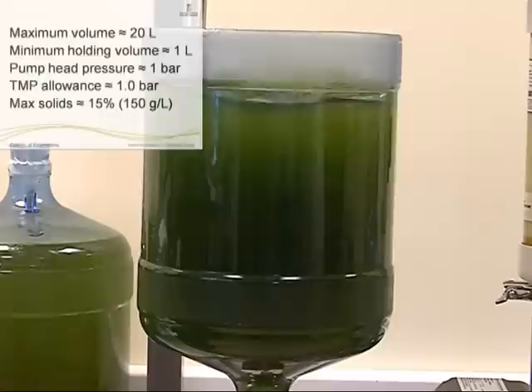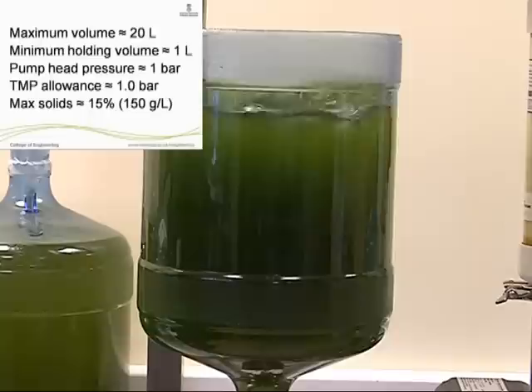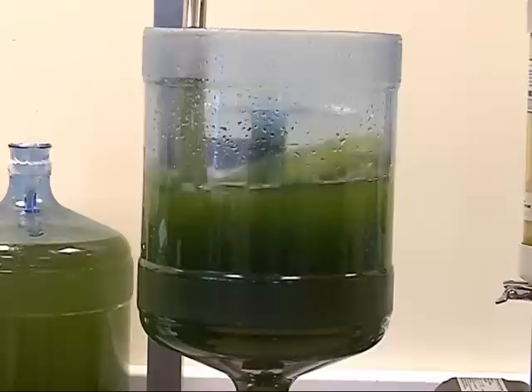As the suspension recirculates in the system, water and salts are driven out of the system whilst the microalgae is retained. The permeate can be collected or directed to waste, and the process can be named dewatering because of that.